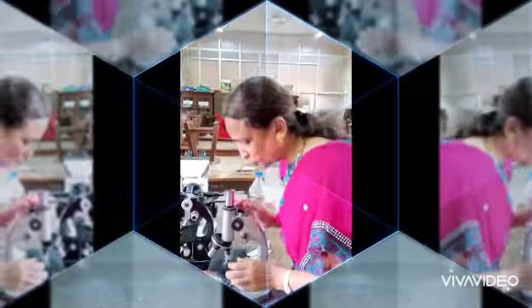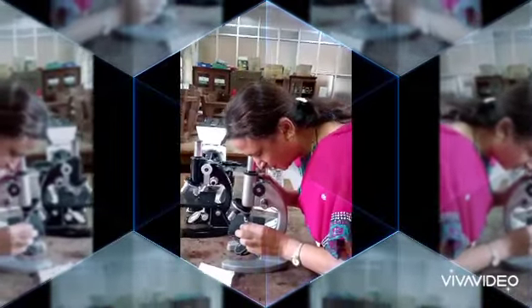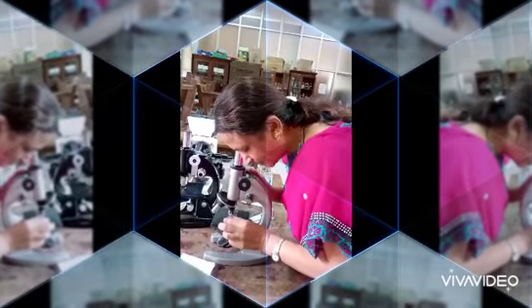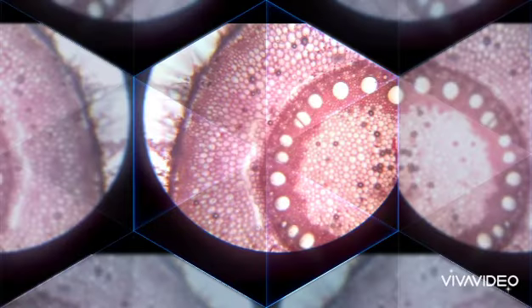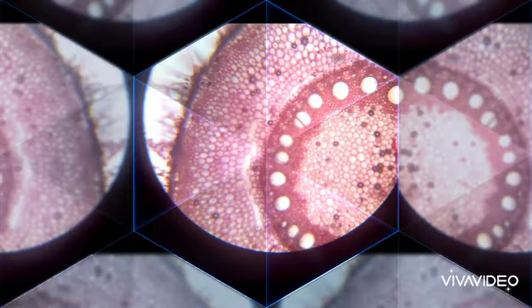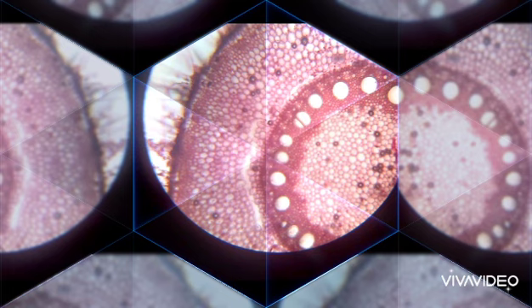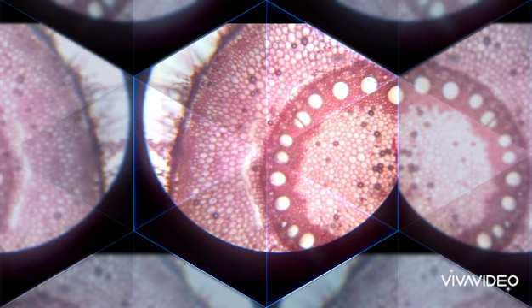Now let us take this slide which we have prepared. The slide is focused under the compound microscope to observe the internal structures of the stem. A transverse section of the stem shows three important regions: epidermis, cortex, and stele.